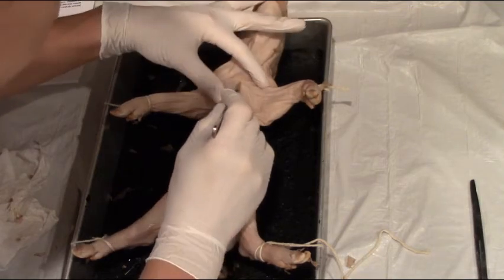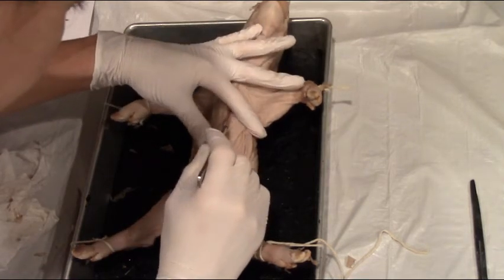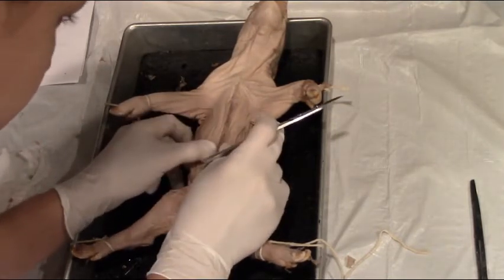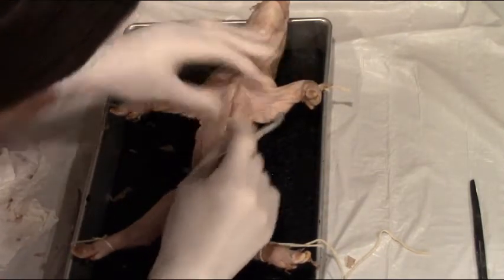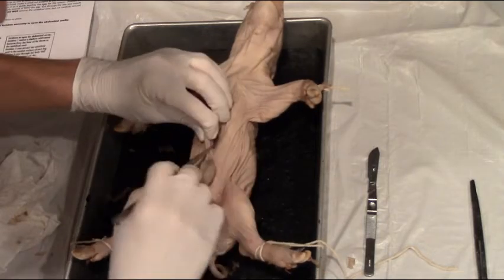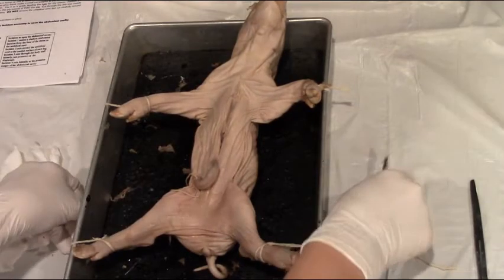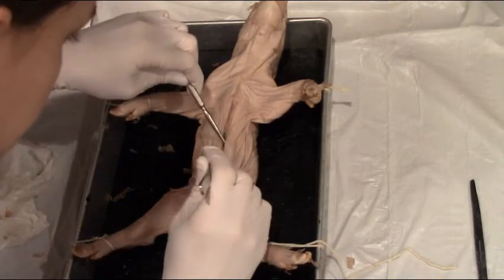I'm using my fingers to spread the tissue apart. Eventually I'm going to want it to give a little bit. I'm using my probe to see how far I am into the abdominal cavity, but I'm not there yet, so I'm just going back over those spots gently. Now I finally am there — I can tell because when I put my probe in, I'm now in the abdominal cavity, no longer just cutting connective tissue. That lets me know how deep I want to cut; I don't want to cut any deeper.